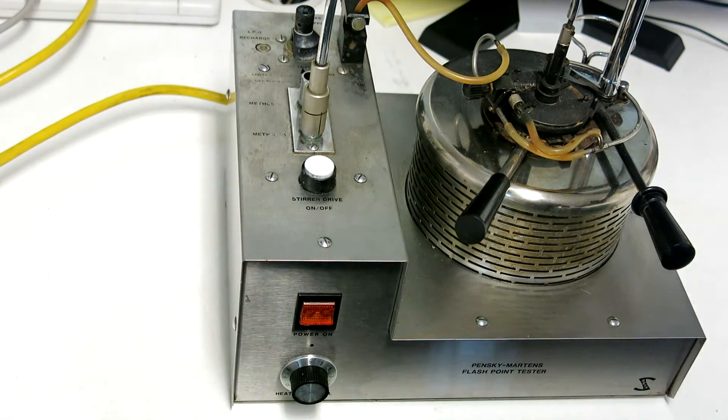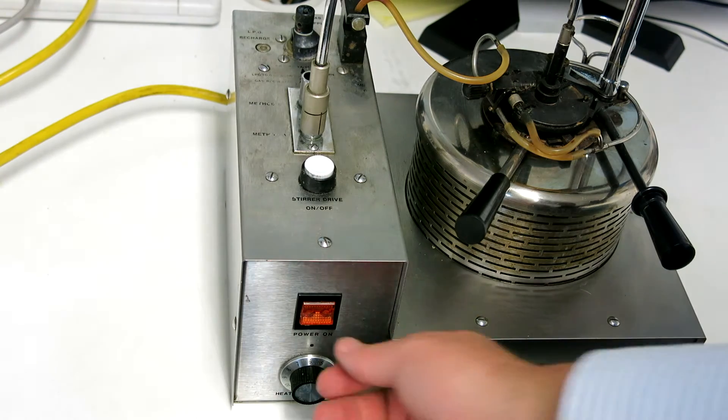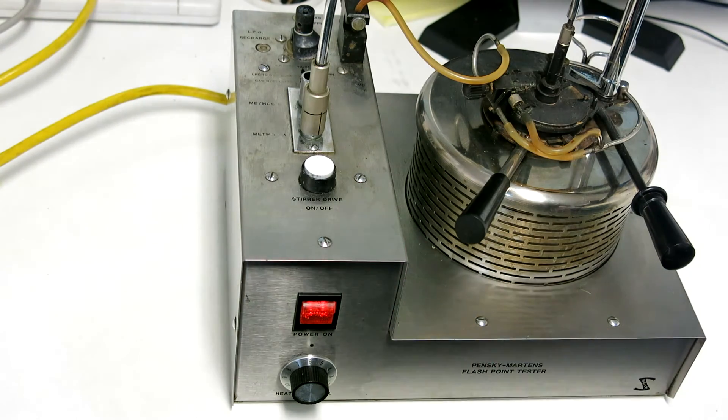So what I'm now going to do is switch the instrument, the power on. Hopefully you can see that it's switched on now.